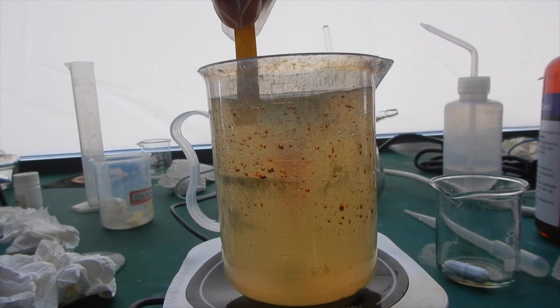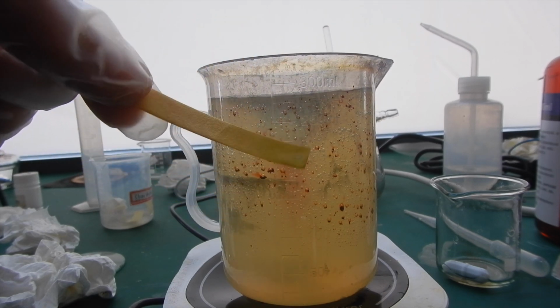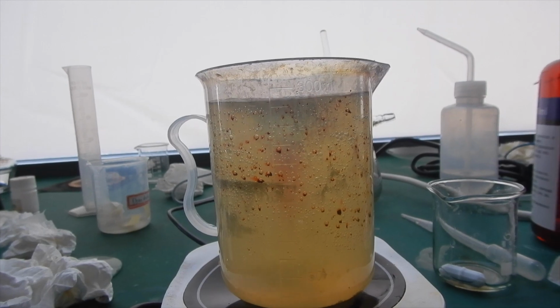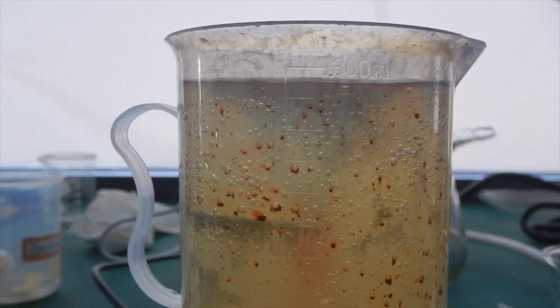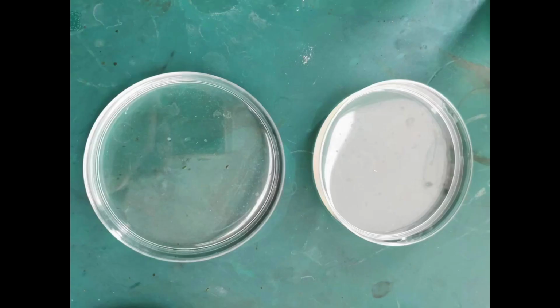After a few minutes, I checked the pH of the solution, and it was around neutral. Looking back, I should have added some more potassium carbonate and brought the pH to about 9 to remove all the residual iodine. After most of the color disappeared, I stopped the stirring and allowed the solution to crystallize. I poured all the solution into 2 plastic petri dishes, and I left it on the table for a week.